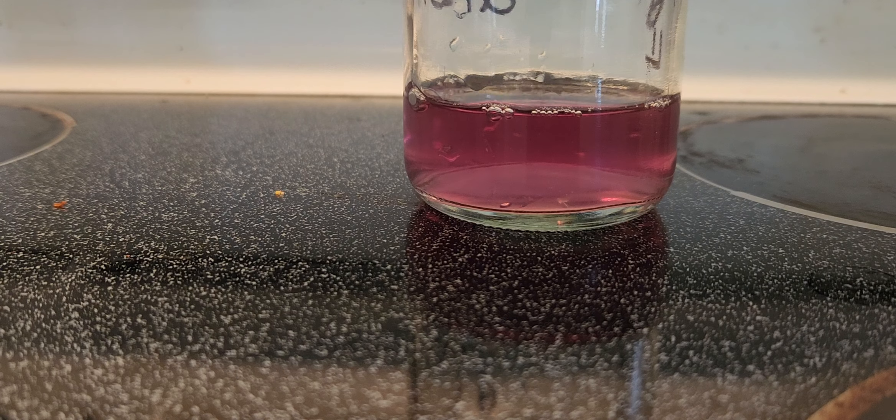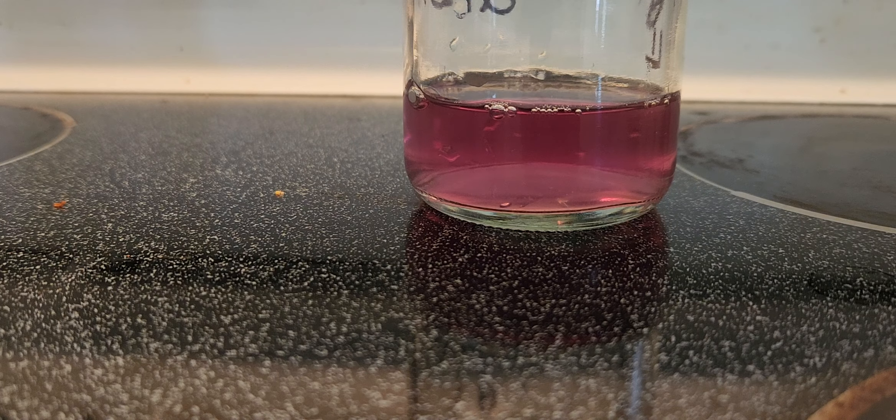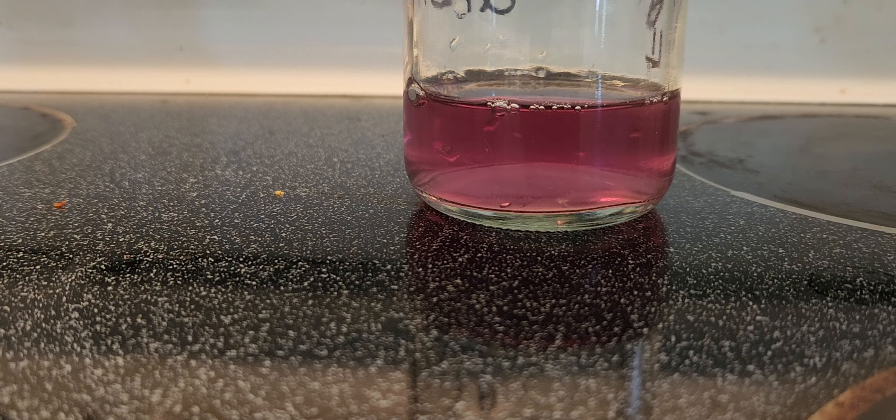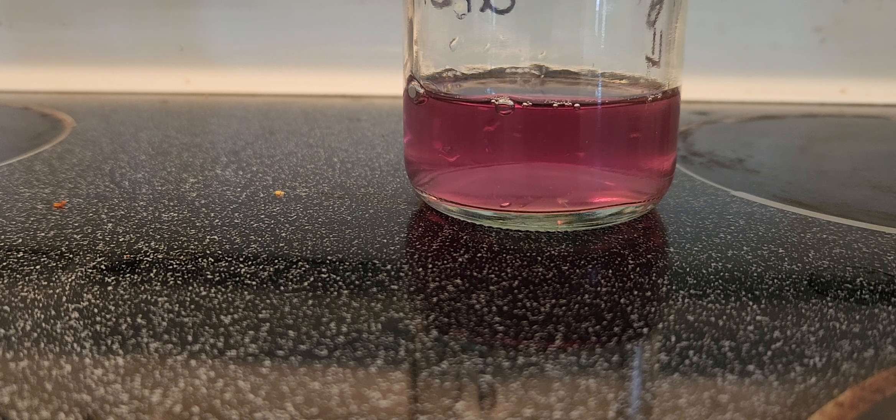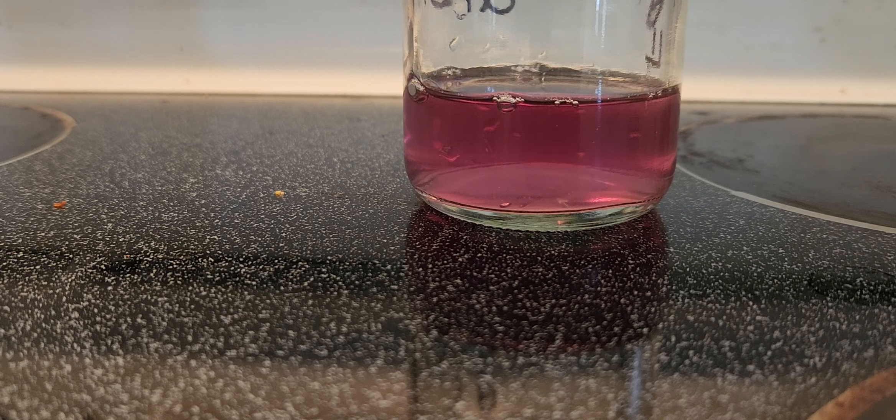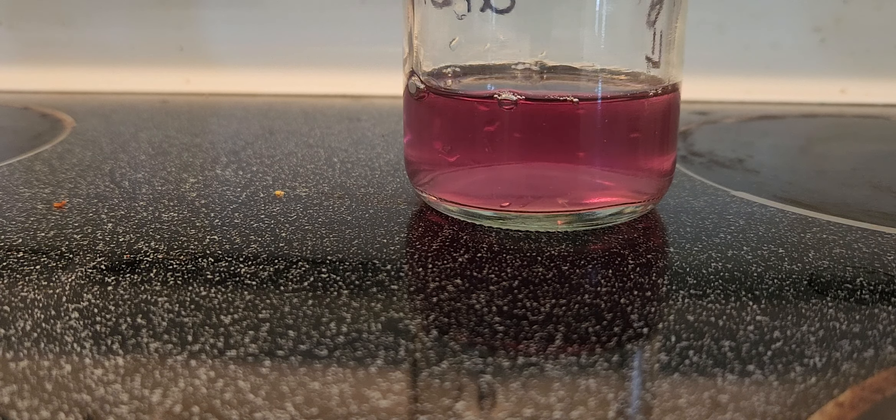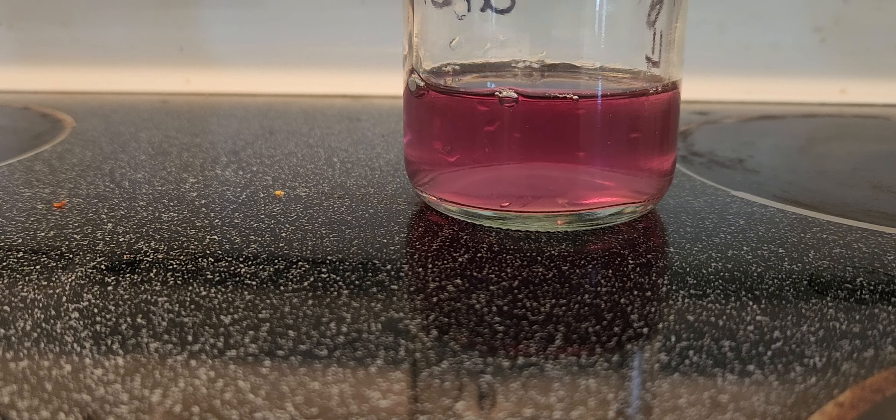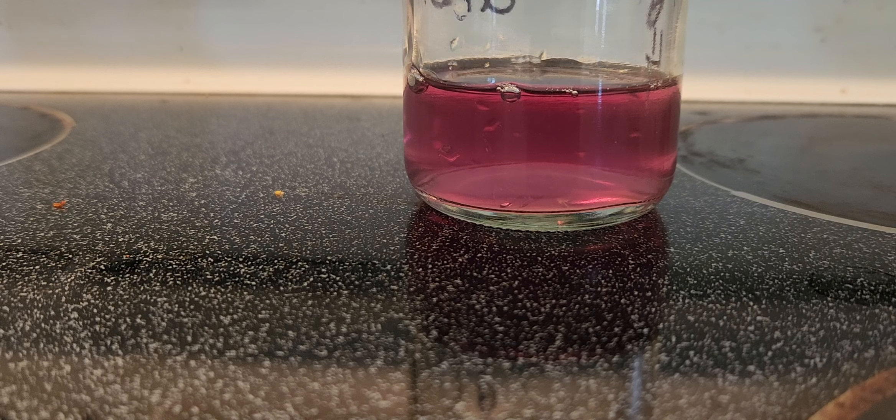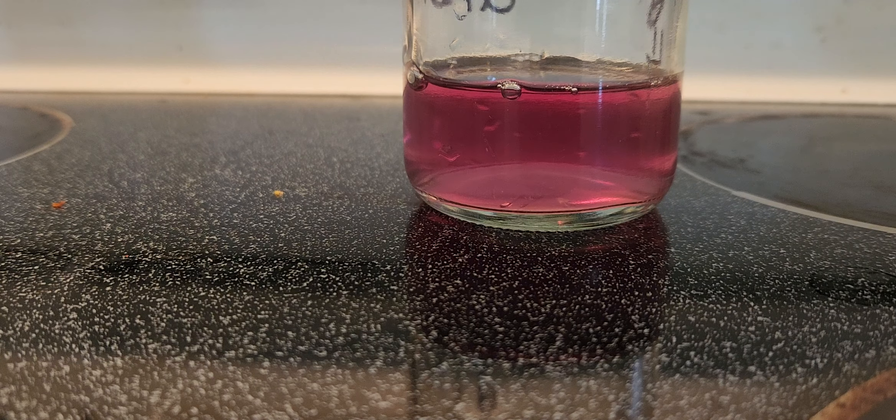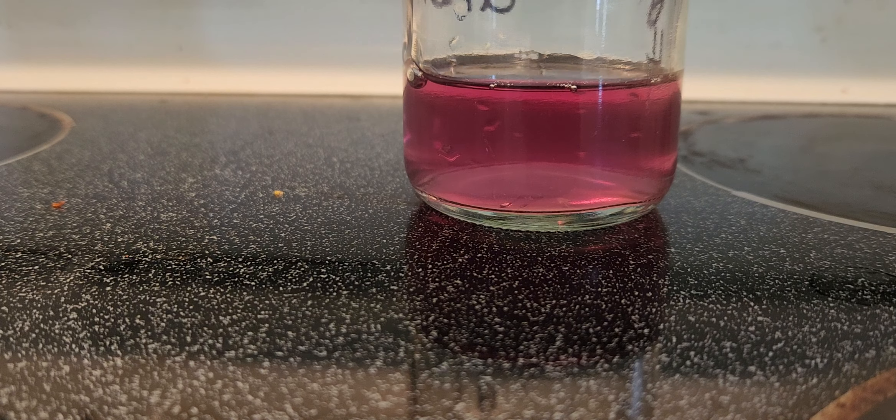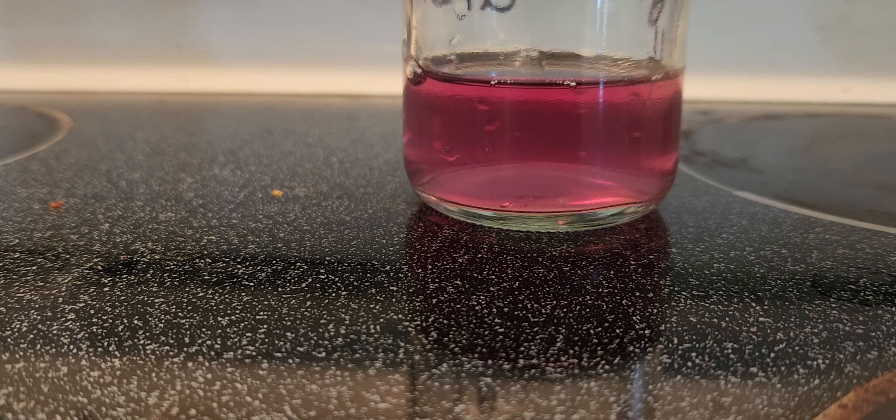A lot of it just sits, it's heated up for a few days and I let it sit in the fridge for a week or so. And that's why it's getting that color.